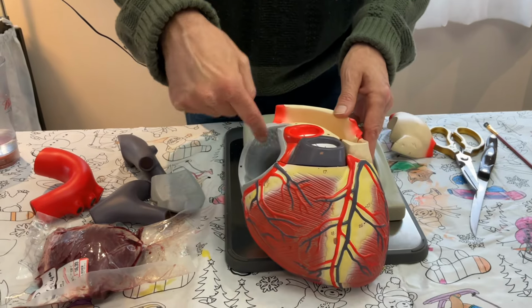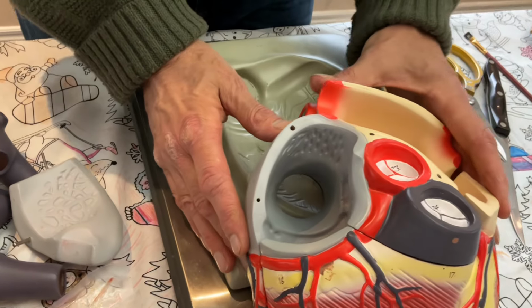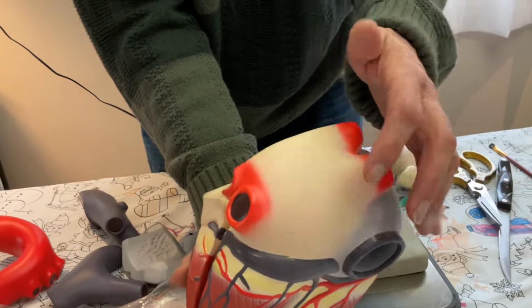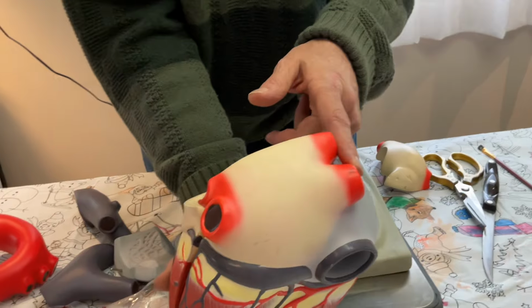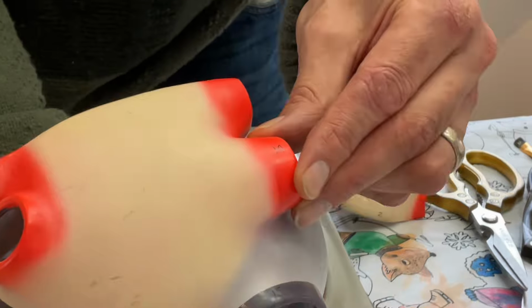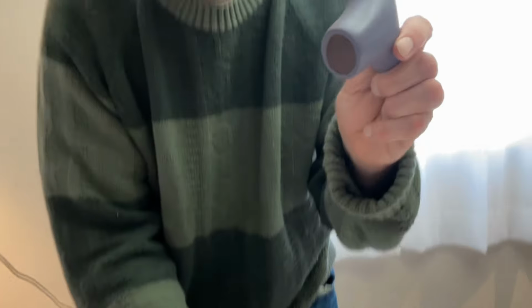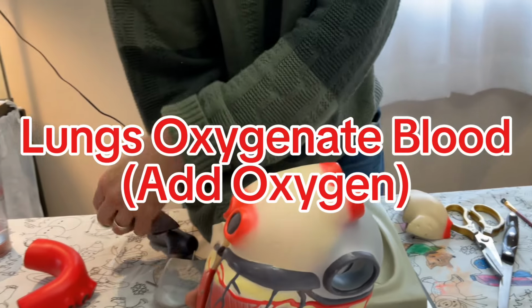So the blood collects in here, coming from the body. The blood collects in here, coming back from the lungs. And these things here are called the pulmonary veins that bring blood back into the atrium. And you'll notice they're red, which means they're oxygenated. This is the only vein in the body that carries oxygenated blood. Just like the pulmonary artery is the only artery that carries deoxygenated blood, because the blood goes to the lungs, gets oxygenated, and comes back.